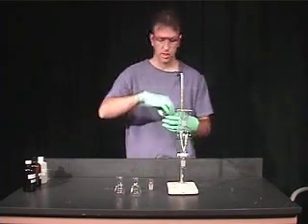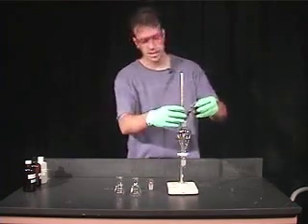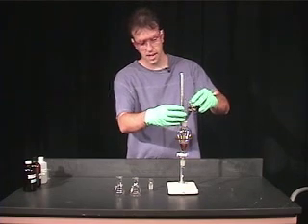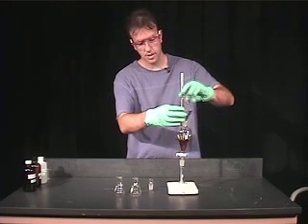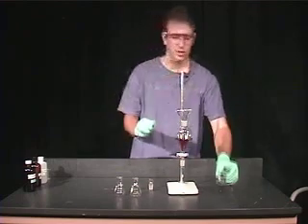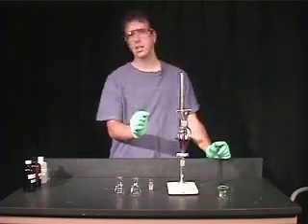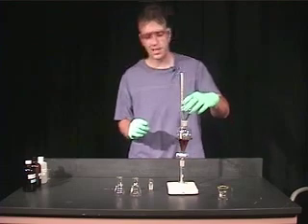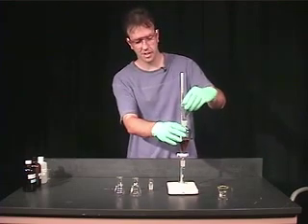The first thing we're going to do is add this solution containing caffeine. When you do this, make sure before you pour it in that the stopcock is closed. I'm going to show you later on what happens if that remains open.